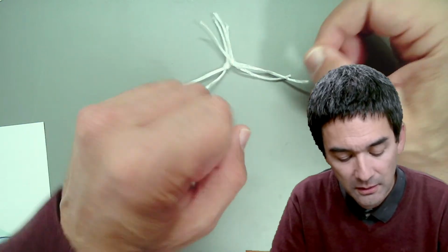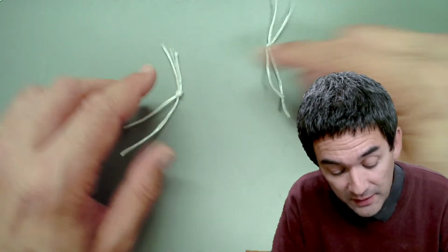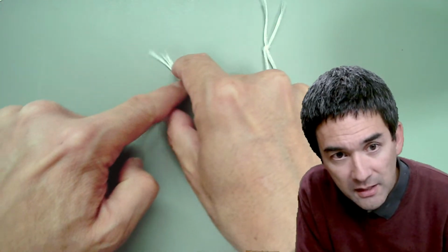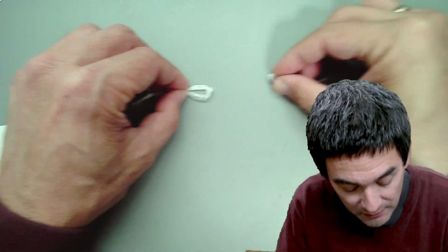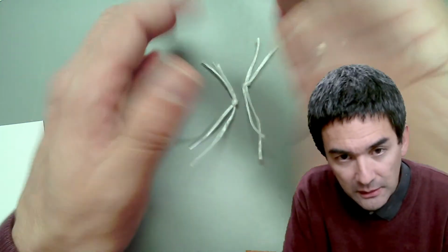And the reason why the cell does that is to create symmetry. We want to make sure that the left and the right cell, the two daughter cells, get the same DNA. At the beginning, before the cell divides, the DNA is spread all over the cell, and the cell wants to create symmetry. For this reason, it's pulled to the center, and as this happens, those arms fold backwards, because after all, the cell is mostly liquid. This is referred to as metaphase, where they line up in the middle.